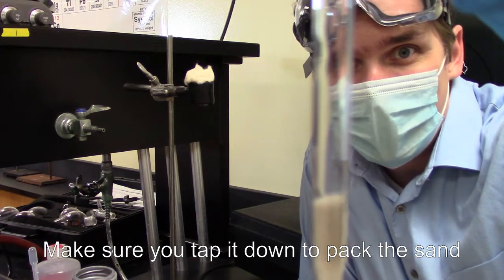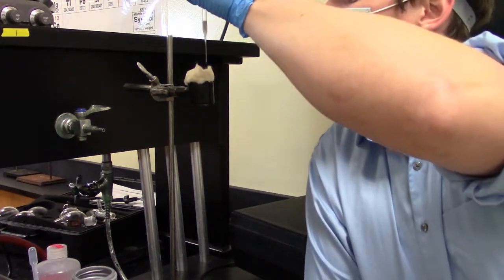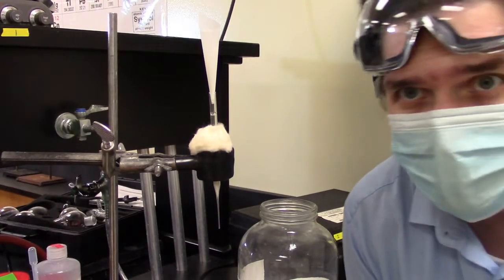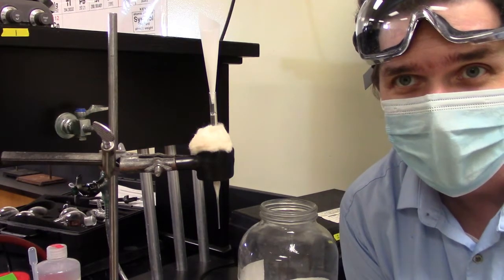And what you're going to end up with is just your first half centimeter of sand. And from here, this is where we start adding the silica gel. All right, so now we're ready to add the silica gel.